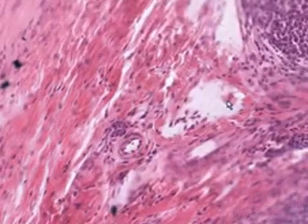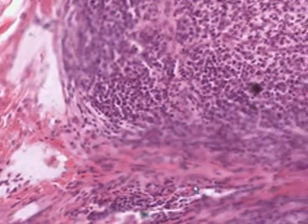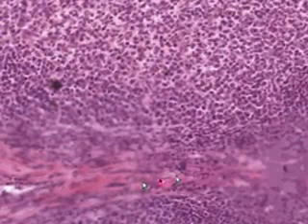There's an artery. There's probably a vein there and there. There's some lymphoid tissue. Whenever you get a lot of lymphoid tissue, you know that you're probably in an ileum rather than a jejunum. There's an extension of submucosal connective tissue, possibly to form a plica circularis, which increases the mucosal surface area.